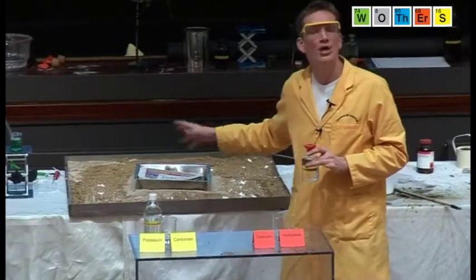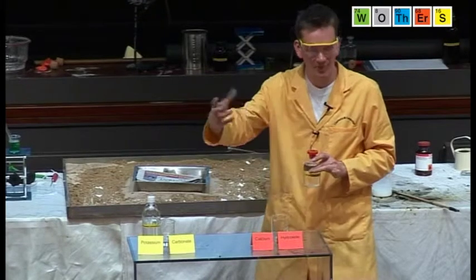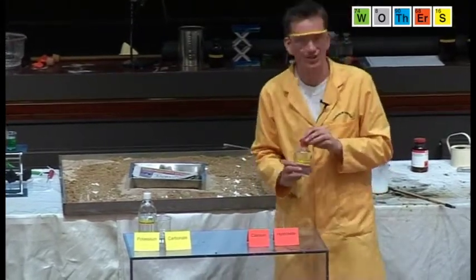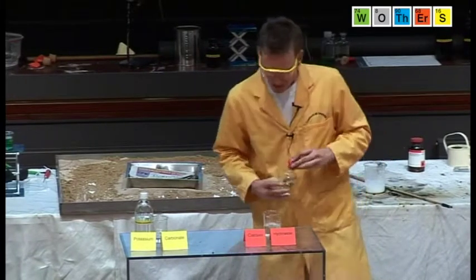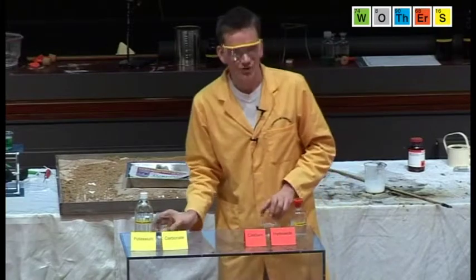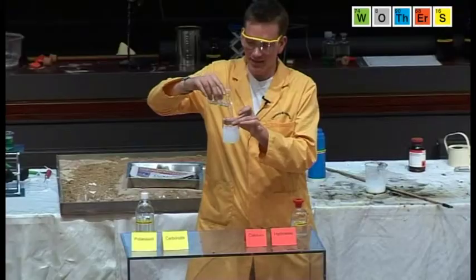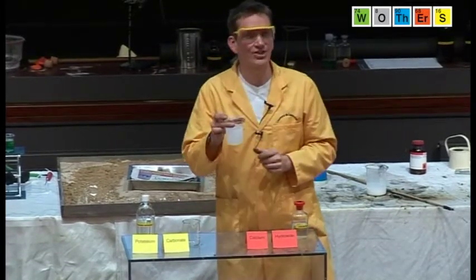Remember, that's what we made from the stone, heating up the calcium carbonate and driving out the carbon dioxide. We've got calcium oxide, then add water to it, we end up with calcium hydroxide. Well, here's a solution of that. And the clever thing is, when you mix these two things together, okay, you get a milky colour here. The white colour that you see here is calcium carbonate.